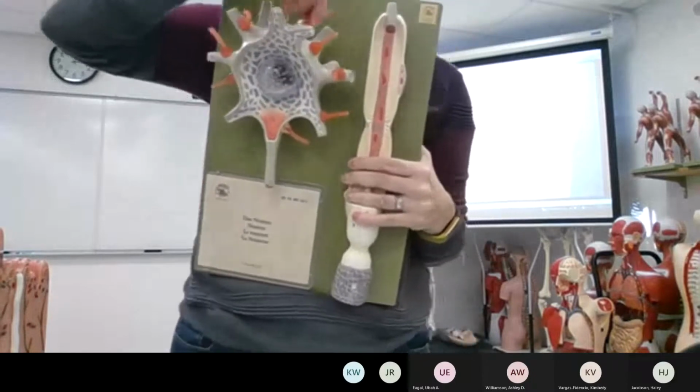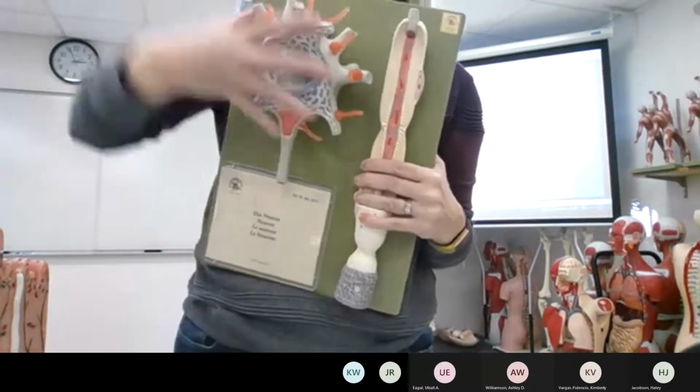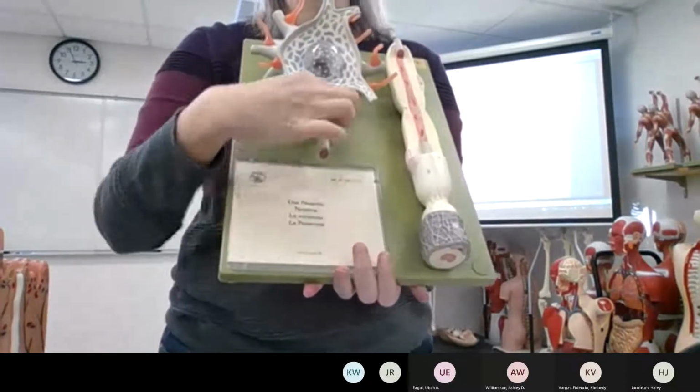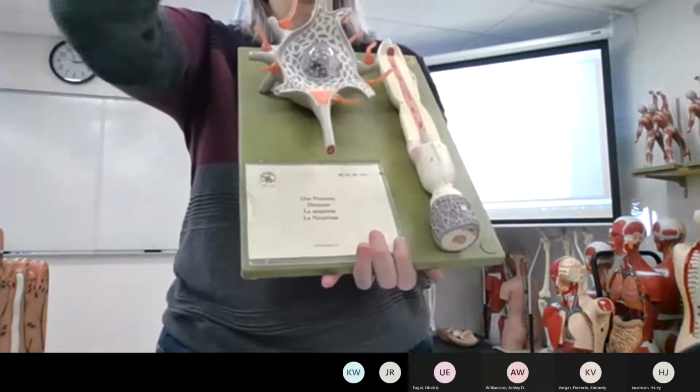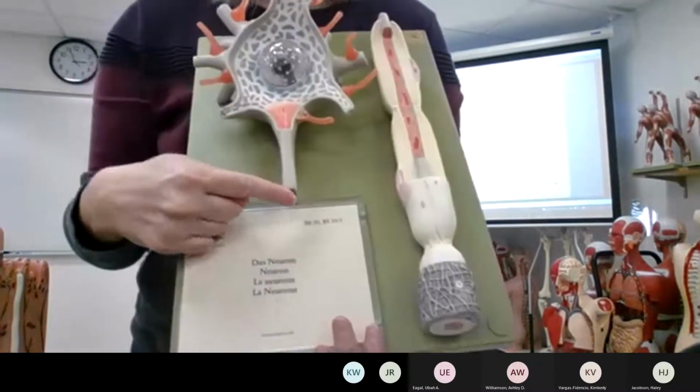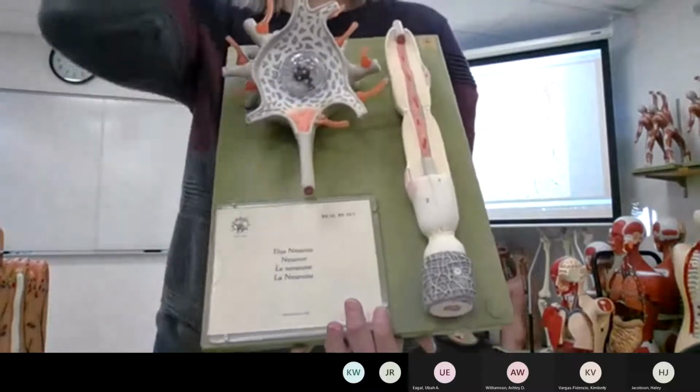So all these little rubber things are synapsing axons on this neuron. Normally you'll start to see one protrusion and it'll quickly disappear because it gets super thin. But in theory, that projection, which would connect here, is your axon.